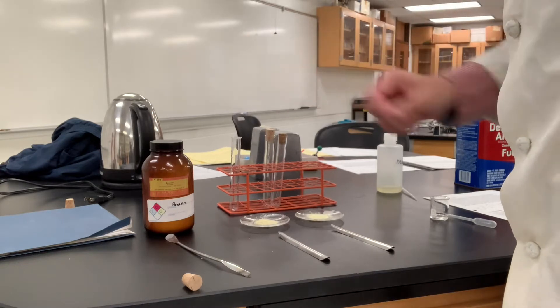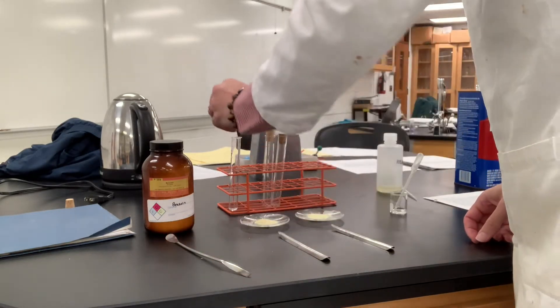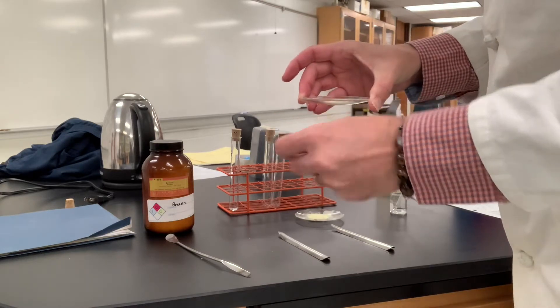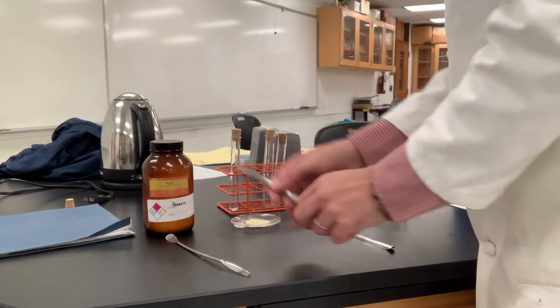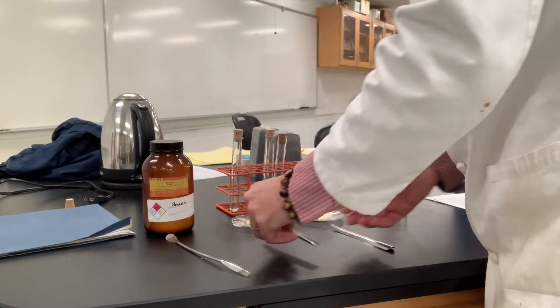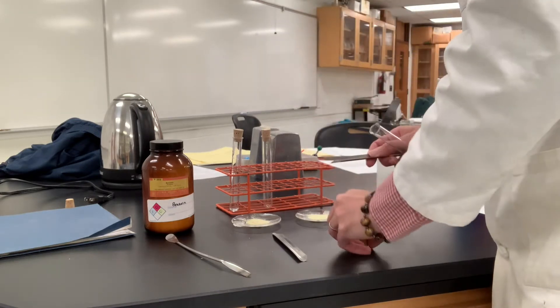The test tube on the left is benzoin. I'm going to add half a milliliter of denatured alcohol and cap that for now. In the middle test tube, I'm going to be adding half a milligram of the copper acetate catalyzed reaction — I know because I've taped that on the bottom. Using a different spatula so we don't get contamination, we'll add just about half a milligram. On the third test tube, we're going to add half a milligram of the copper nitrate catalyzed reaction.